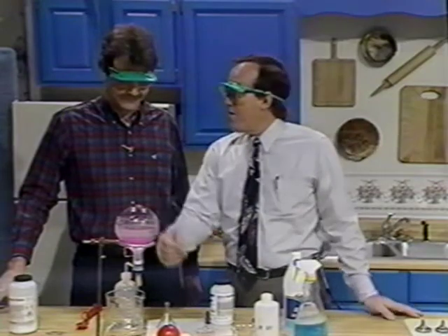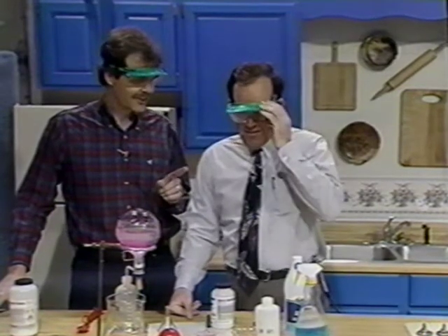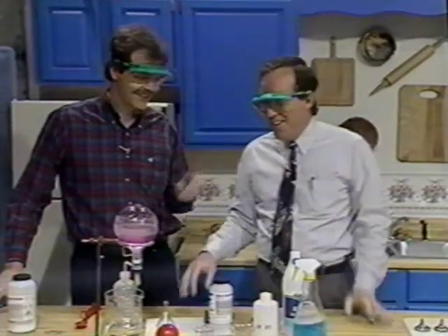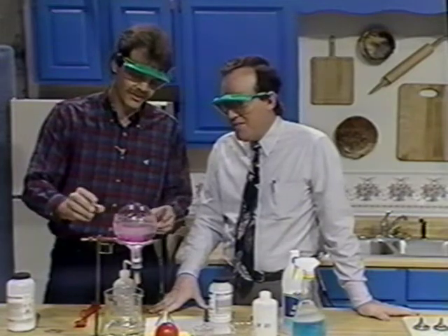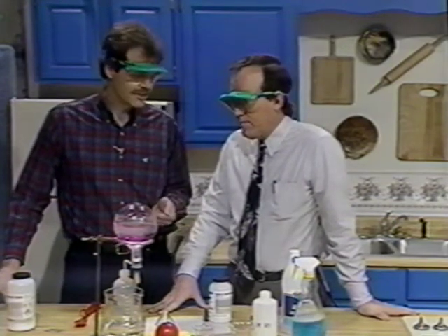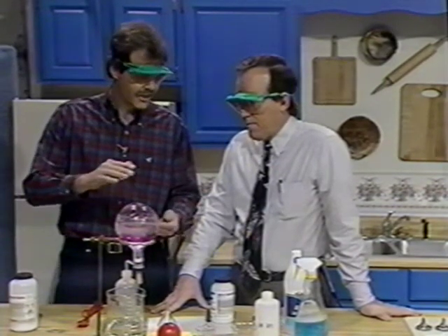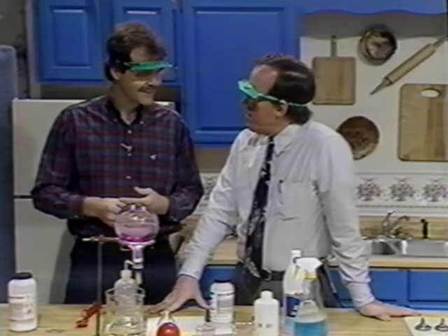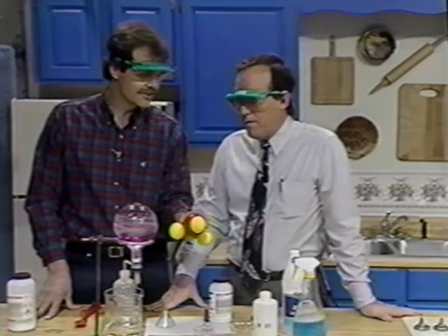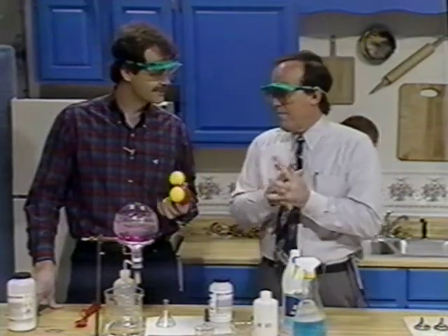This gives you some indication why Pepto-Bismol is that color, because it neutralizes stomach acid. Phenolphthalein is actually the active ingredient in Ex-Lax, so they don't put that in Pepto-Bismol. The story here is why does the pressure drop so much when you squirt water into the flask? Because ammonia is incredibly soluble in water — you can take a liter of water and dissolve 1,130 liters of ammonia gas into it. Knowing the structure of the ammonia molecule and the water molecule allows us to explain why they're so soluble.